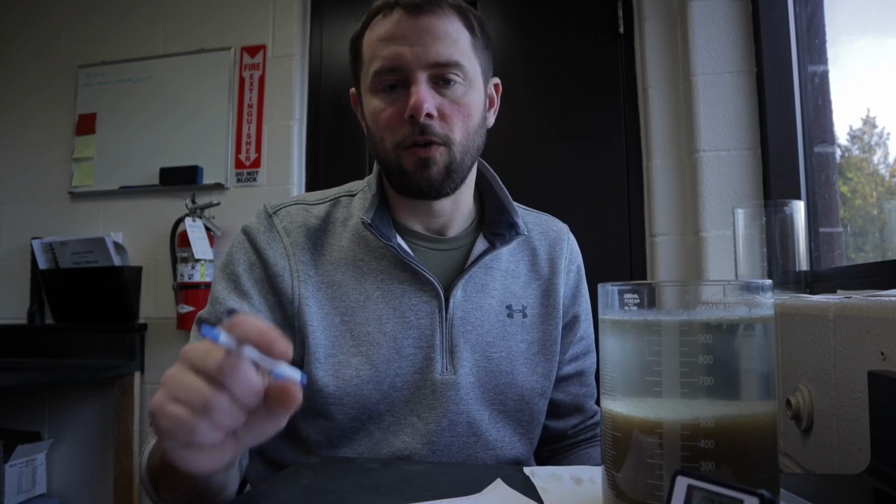With all the data gathered, we can track from day to day, at a given time and at a given flow, what might be happening in our process. It's important to track things like the time and the flow, because here at least we have a pretty good diurnal, and you can see variations in this process lab based on those factors. So if you were wondering if something might be wrong or might be different, you really have to account for all those variables. So there you have it, guys, a basic process lab.